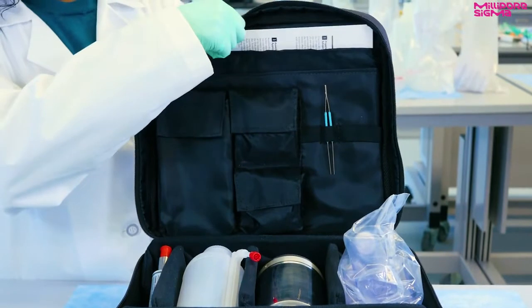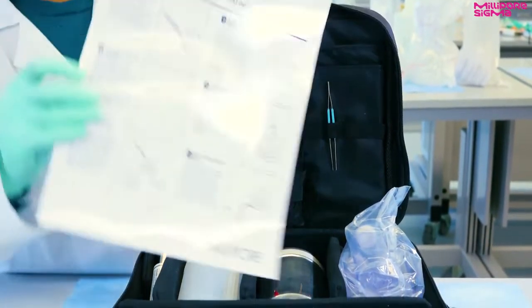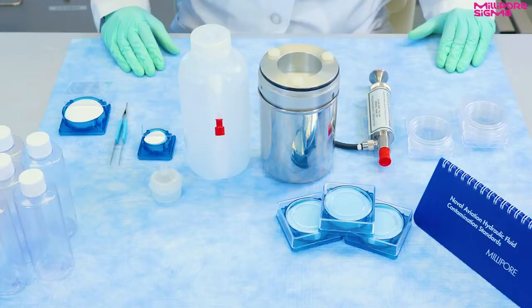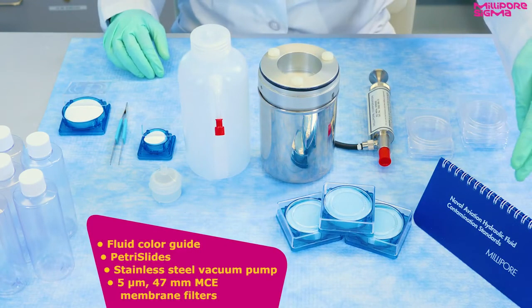Generic operating instructions are included in the kit. It is recommended to consult your regulatory method for specific details. Let's take a look at all the components provided in this kit.